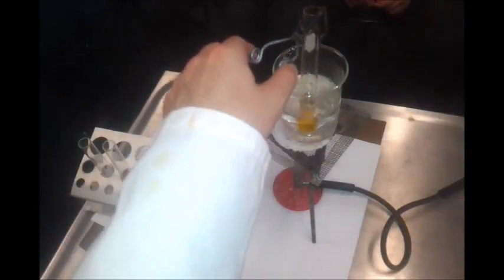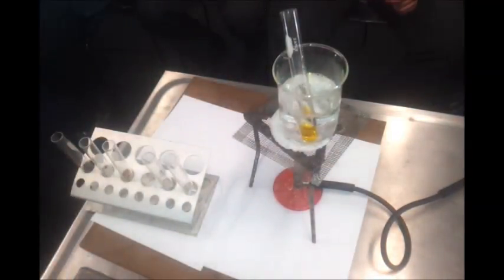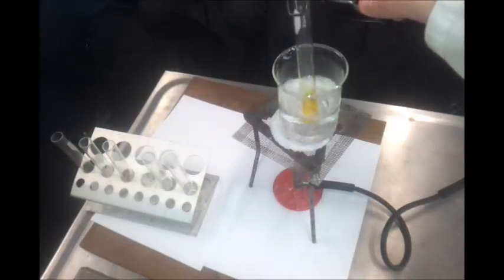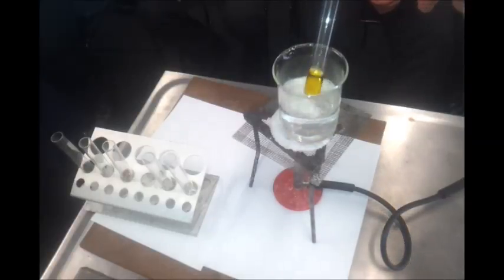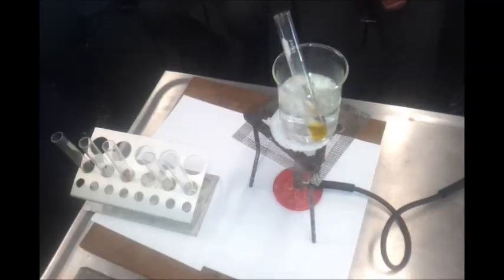And this one does need heat if I want it to go fast. So I'm just going to leave it in there for a wee while. It starts off, it goes yellow straight away. That's just the dilution of the orange colour, really. There's a little bit of a reaction happening, but it's primarily just a dilution of the colour. And then slowly, as I leave it, it'll start developing a new colour. So leave that to do that for a wee bit of time.